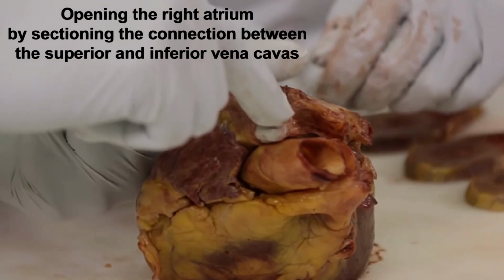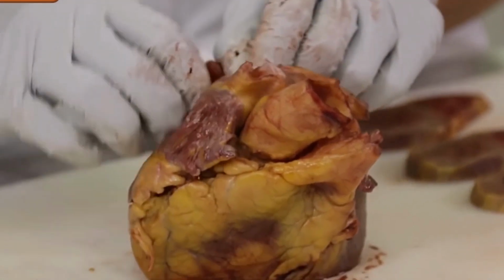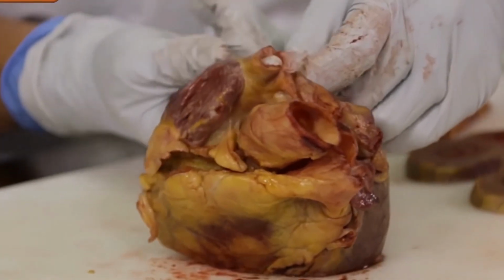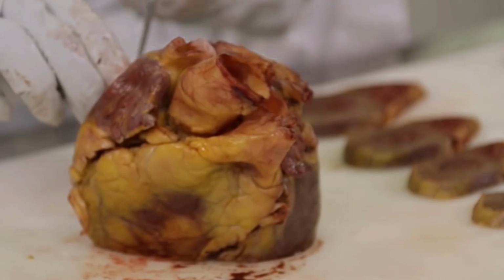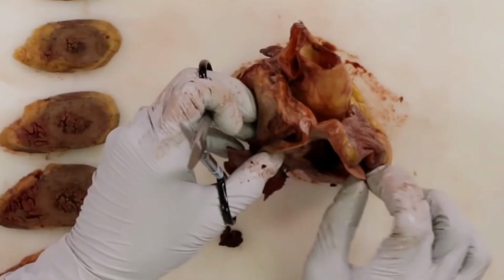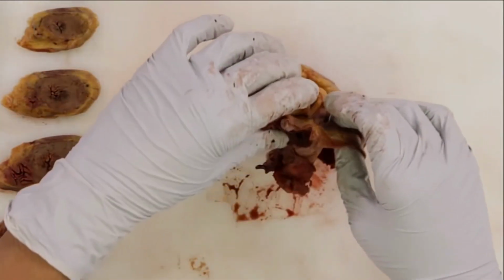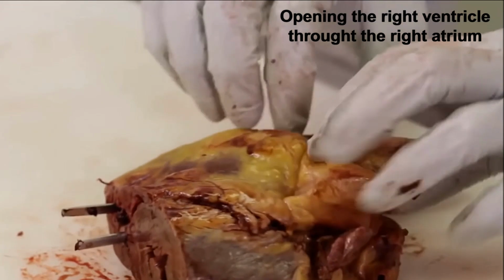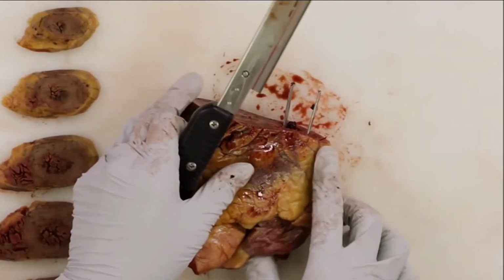And now we are going to proceed with the opening of the right atrium, and then from there we're going to go into the right ventricle and produce an exposure of the cavity of the right ventricle. You can use either a scalpel or a blade or just good scissors to get the section done. As you can see, not all the heart has been sectioned, but basically about 1 or 2 centimeters from the valves you will stop making this section.